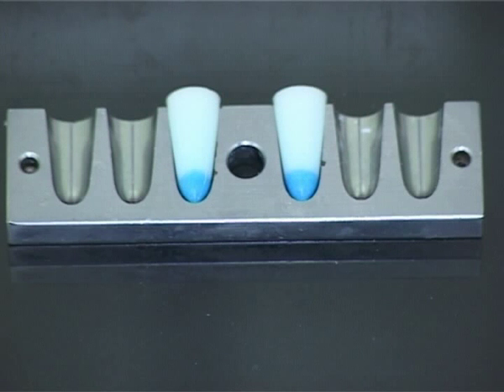The blue nose suppositories demonstrate how the insoluble medicament may not be uniformly distributed throughout the suppository. This happens if the suppositories are poured too early when the base is not close to its solidification point.